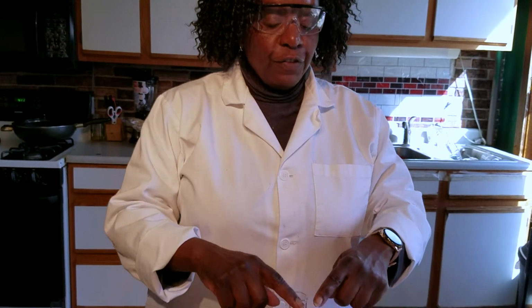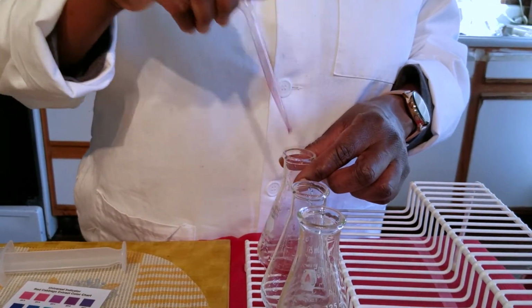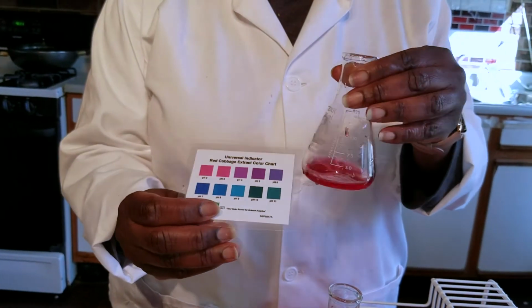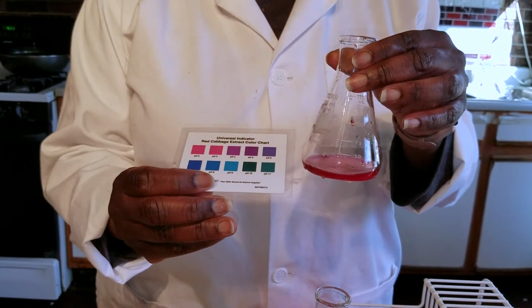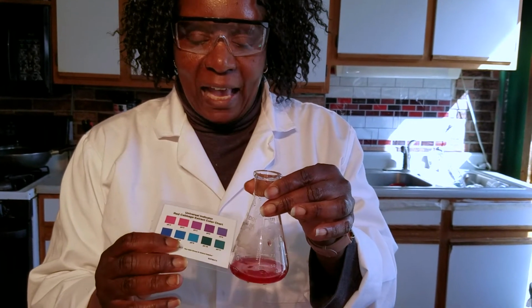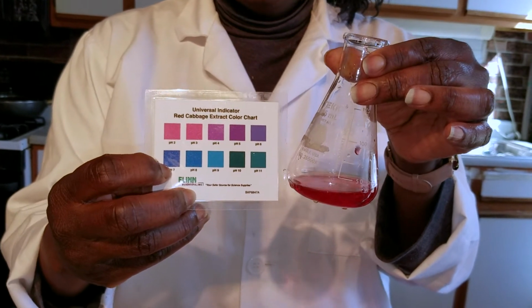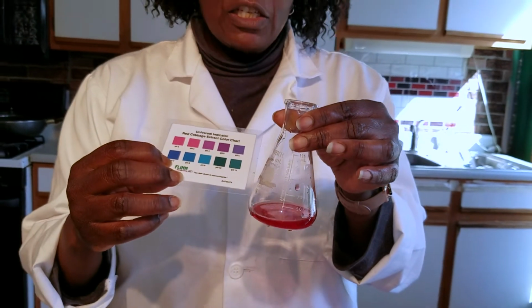To each of the flasks, we're going to add the indicator, which is the red cabbage dye. Now, red cabbage dye has a range of shades. The reds are in the acid range, and the greens and blues are in the base range. So we are going to add a base until we neutralize this acid. And over here, you can see a pH of 7, which will mean that the acid is neutralized, because an acid and a base react to form salt and water.